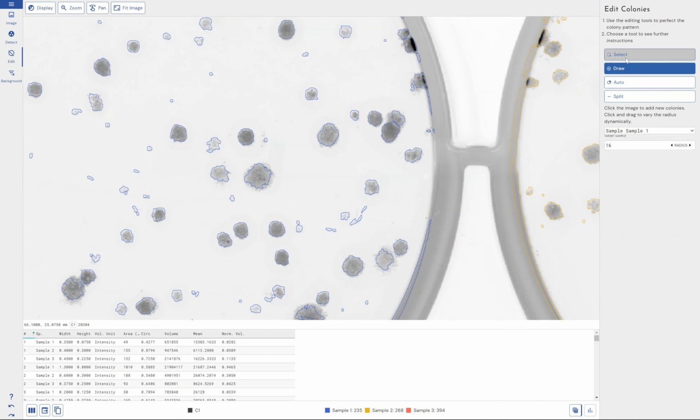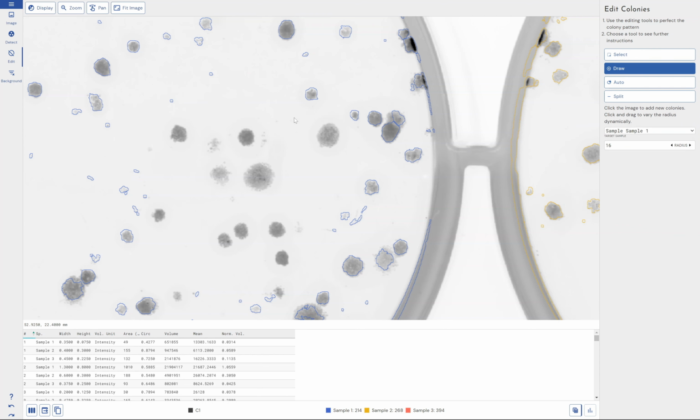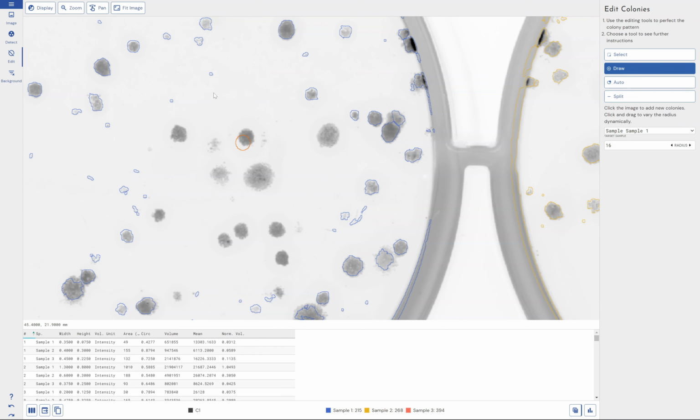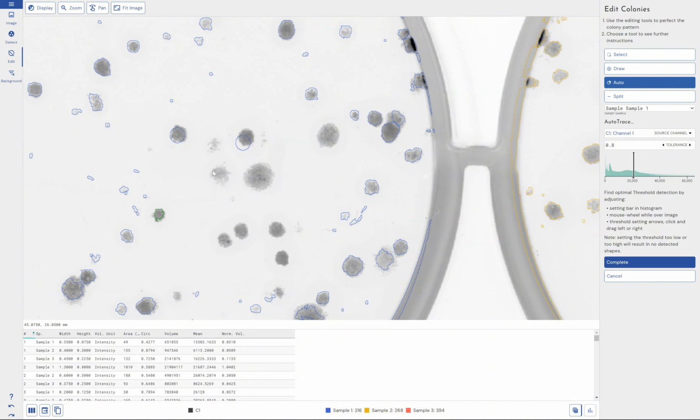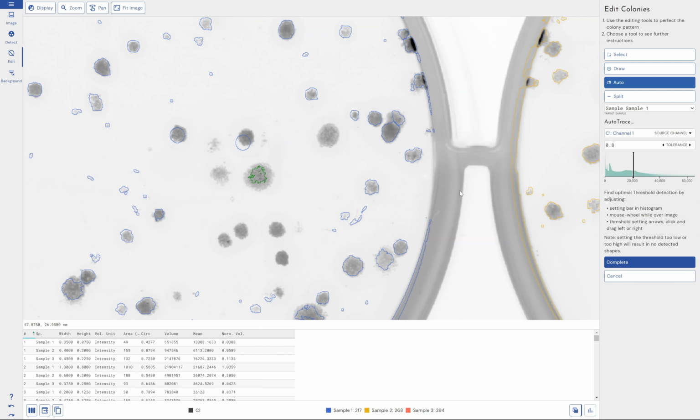So if I just delete some spots here, just selecting them and pressing delete on my keyboard, I can draw new spots. Kind of drag them to where they need to be. I can change the radius of the spot that I'm going to be putting this on, and I can generate an auto detection. So I can click on a spot and have an auto detection function run for me. And if I click on another spot, it will automatically accept it.